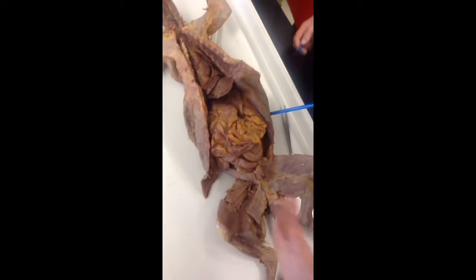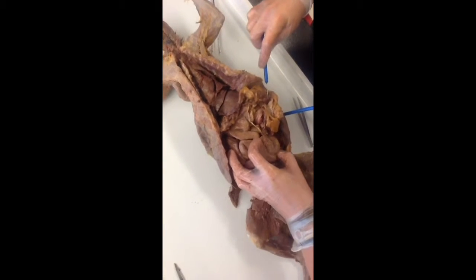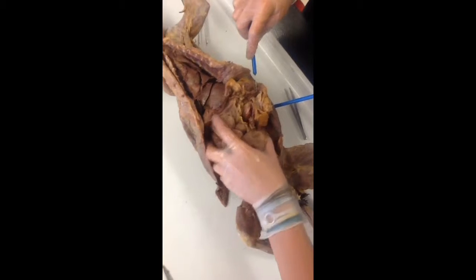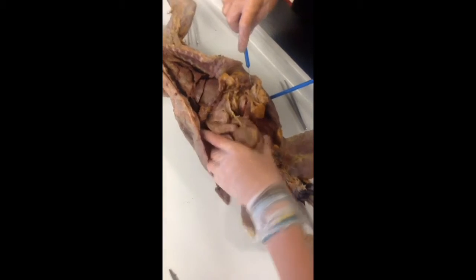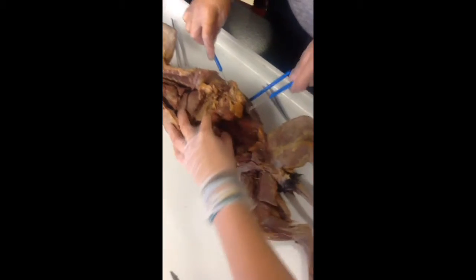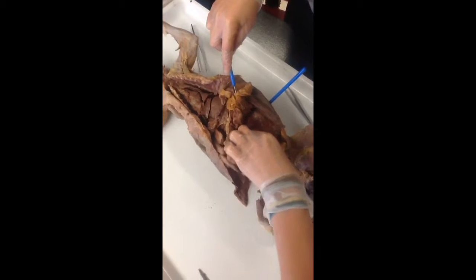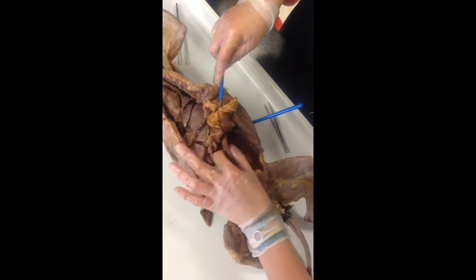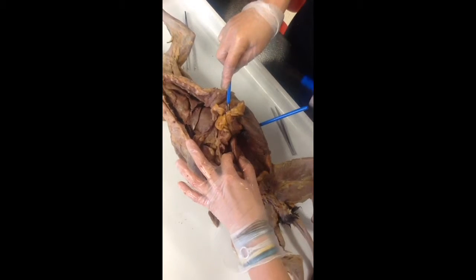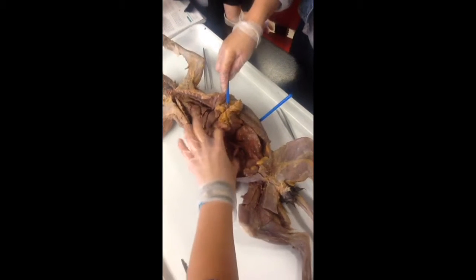Okay. So then, what is this big stuff? Is that the colon? No. It connects to the colon. Small intestine. Be careful, because we don't have a large intestine. I'm not asking you about that in here because it's the same thing as the colon in the cat. So it's going to connect to your colon. Where is it? Oh, here it is. Okay, so this is your colon. It's kind of underneath the small intestine. So you can see here too that they connect all the way up here.